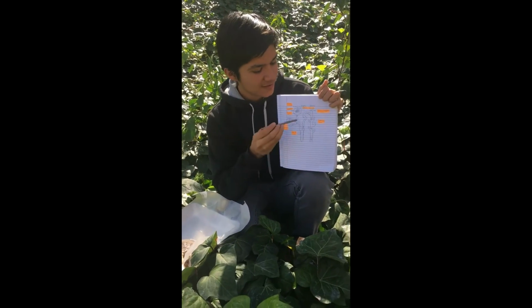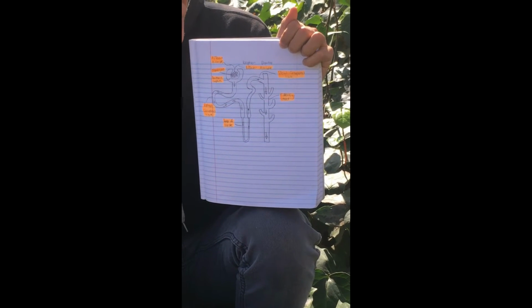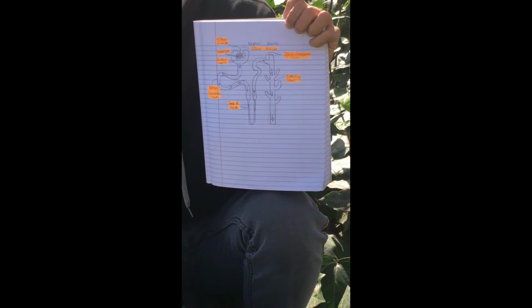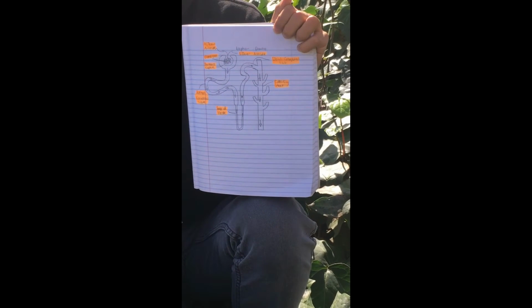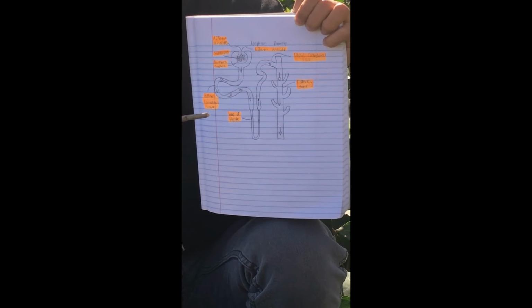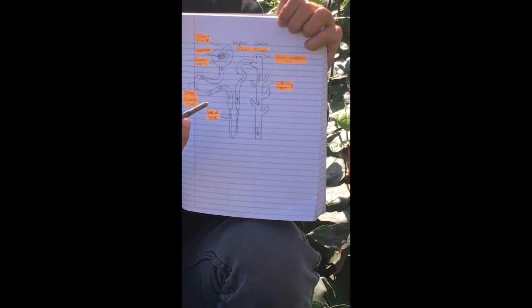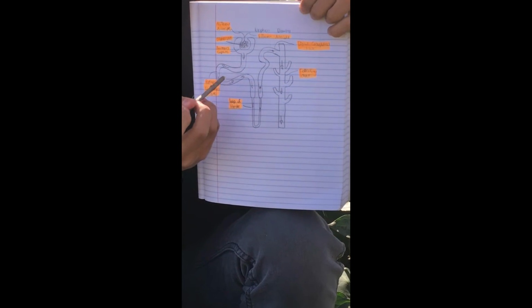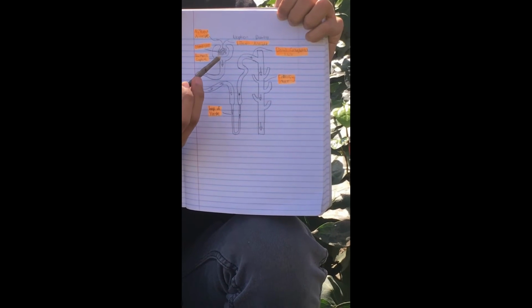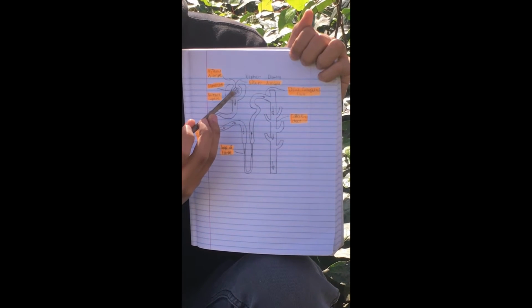Yeah. Record this, not me. Sorry. And the way blood and urine is filtered is by going through the renal artery, which leads into the kidneys. And inside the kidney is the renal medulla. And inside the renal medulla is the medullary pyramid. And inside the medullary pyramid are nephrons that filter out the blood and urine by starting off in the Bowman's capsule. And in the Bowman's capsule is the glomerulus.